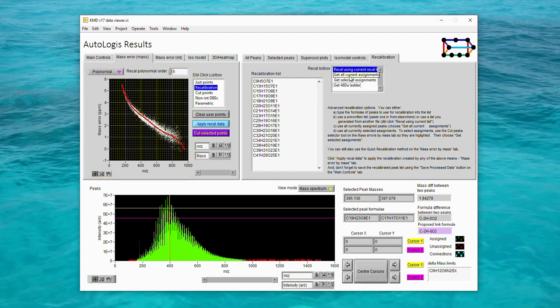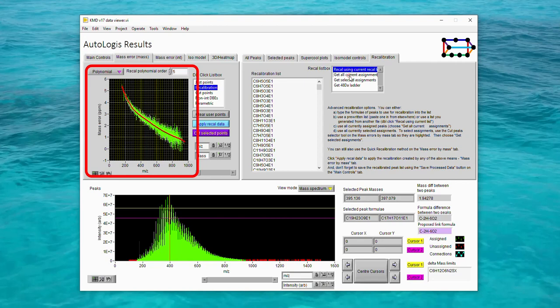This method of finding an internal recalibration function is broadly akin to standard manual methods for internally recalibrating complex organic matter spectra. But because errors are statistically distributed, the more points you have in your internal recalibration function, the lower you would expect the overall global error to be, providing that is your assignments are correct. But as AutoLogis isn't limited by the slow speed of manual processing, it can use much larger sets of recalibration points. So let's look at what happens when we use all the current assignments for internal recalibration. To import all current assignments into the recalibration list, click Get All Current Assignments. That will cause AutoLogis to import all of the assigned formulae into the recalibration list. And it's updated the recalibration curve information as well.